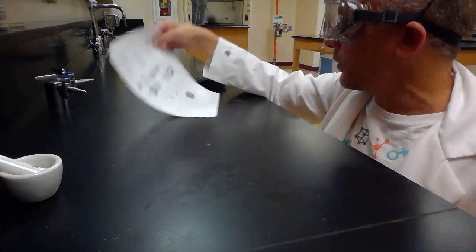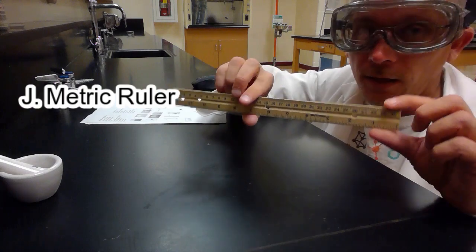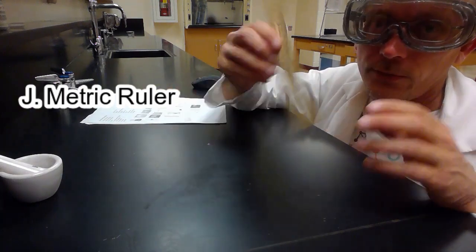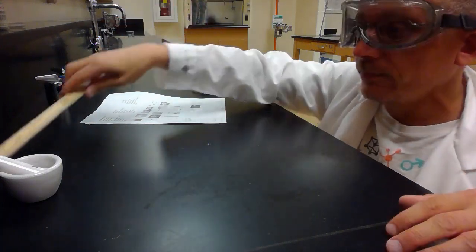I hope everybody recognizes picture J. Picture J is a ruler. I think it calls it a metric ruler on there. Rulers have a metric side and an imperial side. We use the metric side in science, right? So picture J, the ruler. It's used for measuring a length.